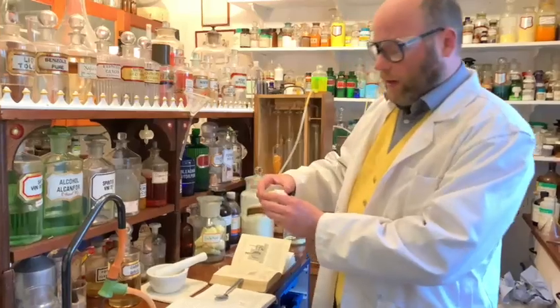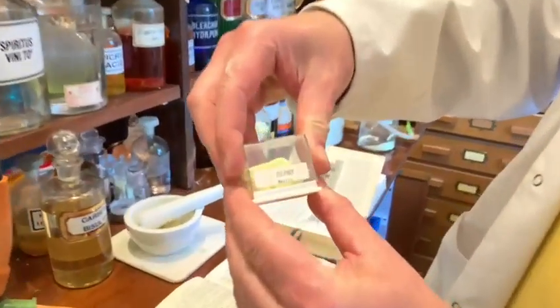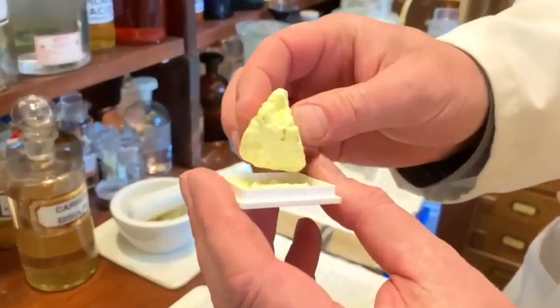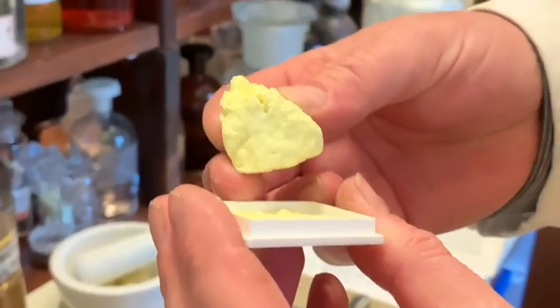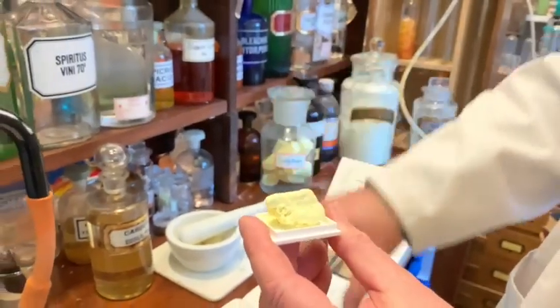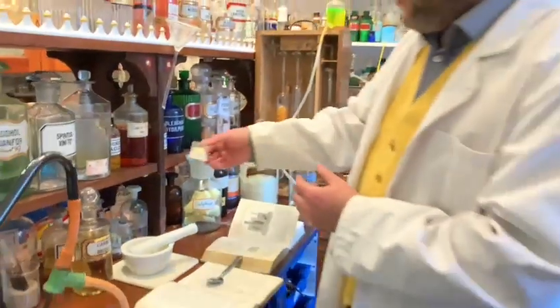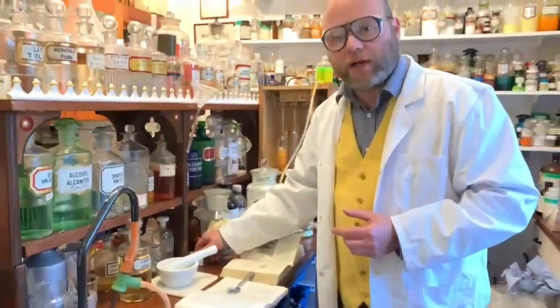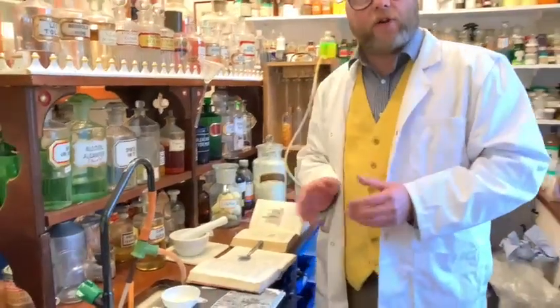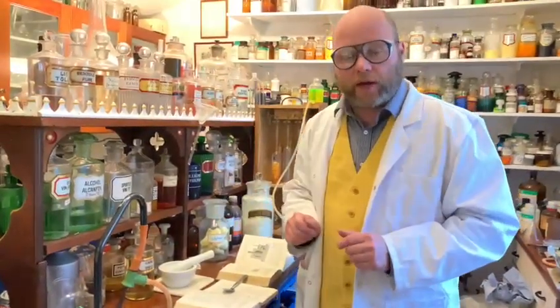Here I have a lovely piece of natural sulfur that came from a volcano in Mexico. You can see the crystalline form that it takes. This is too precious to use, but we're going to make some different crystalline forms of sulfur and show the different allotropes. Sulfur has over 30 different allotropes, though we're familiar with about three or four in normal life.